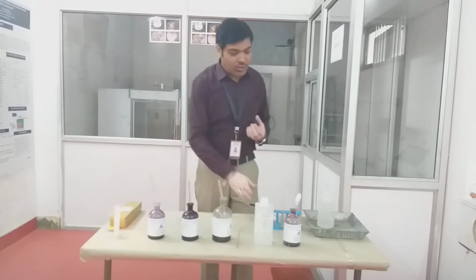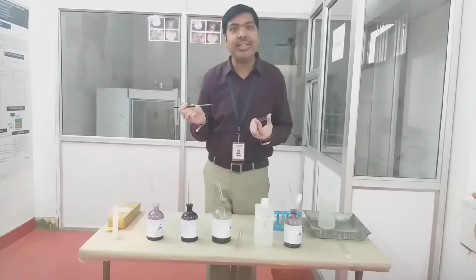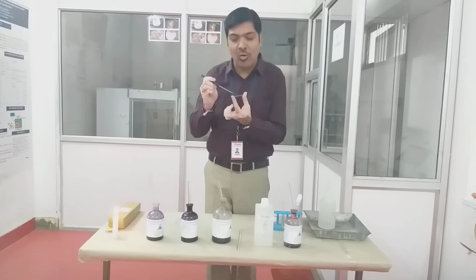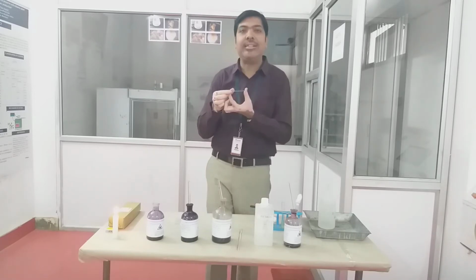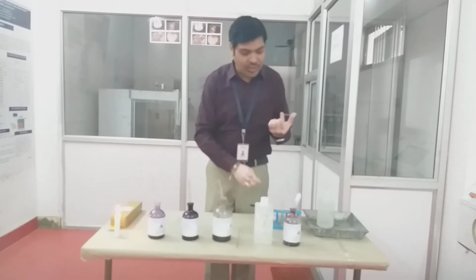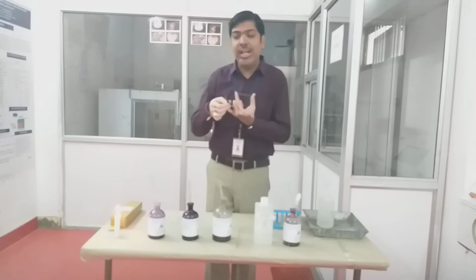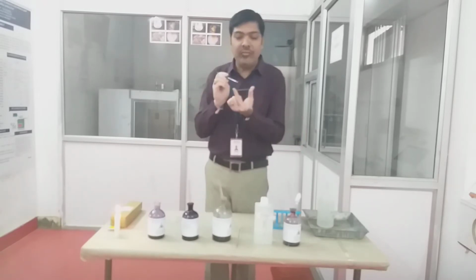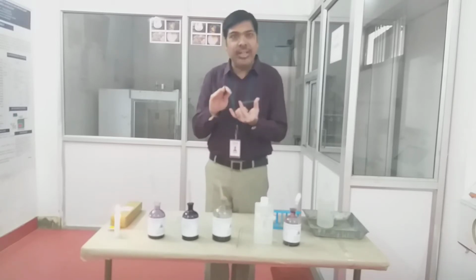Now the next step is you have to take a loopful of microorganism or the bacterial sample that we need to visualize under the microscope. Then we have to make a very thin film of this sample of microorganism on the surface of the slide. First you need to take the slide, which should be very clean. Then we have to take a loopful of culture or the microorganism sample. This device is called an inoculation loop. With the help of the loop on the inoculation loop, we have to take a loopful of the sample and spread it on the surface of the clean slide in the form of a thin layer.